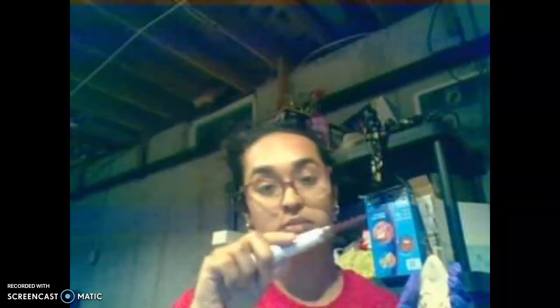Then over here is known as the renal sinus, and this little indent right here is known as the renal hilum. It is usually at the renal hilum where the renal arteries, the ureter and the veins are all attached, which is right over there. And it is through that little indented area, the renal hilum, where the kidney gets all its blood supply and also drains out all of its waste. It's this little indented area right in the side of the kidney.